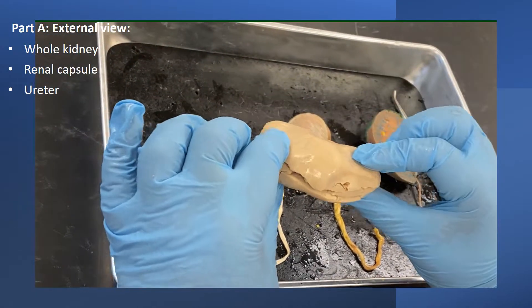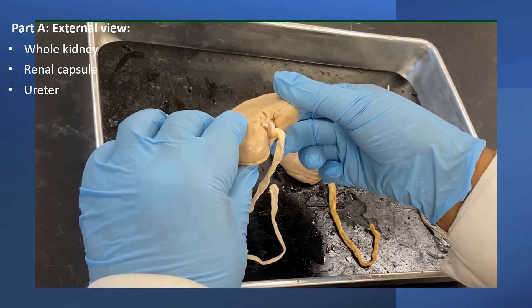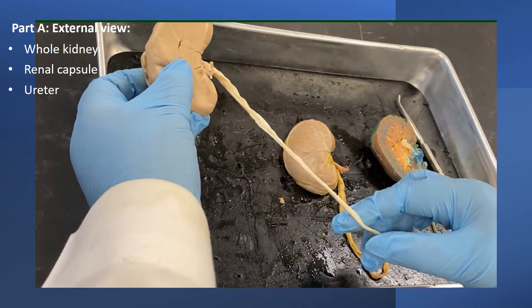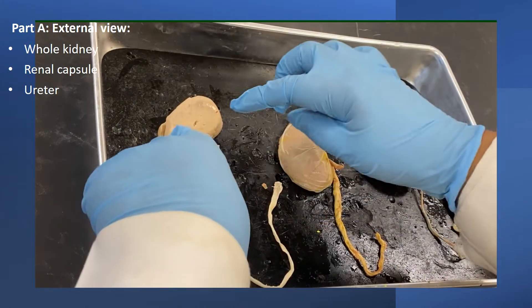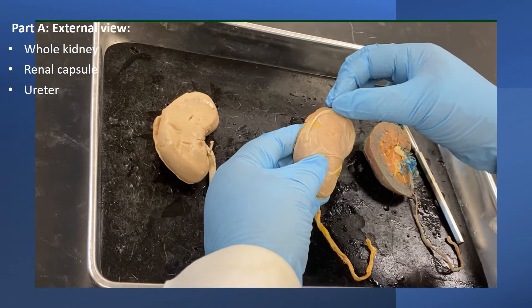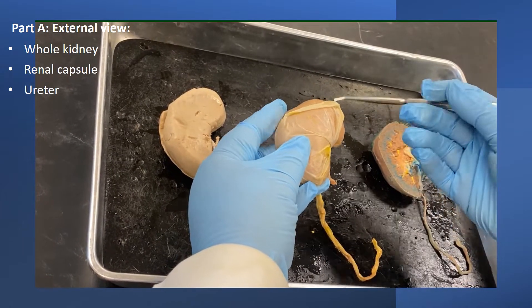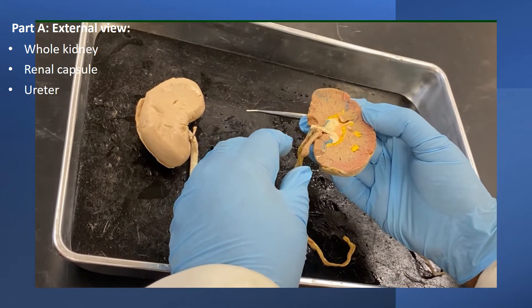Here is a whole kidney and you can see that it has that typical kidney bean shaped structure. This is the ureter. Before we look at the kidney, remember there is the renal capsule.